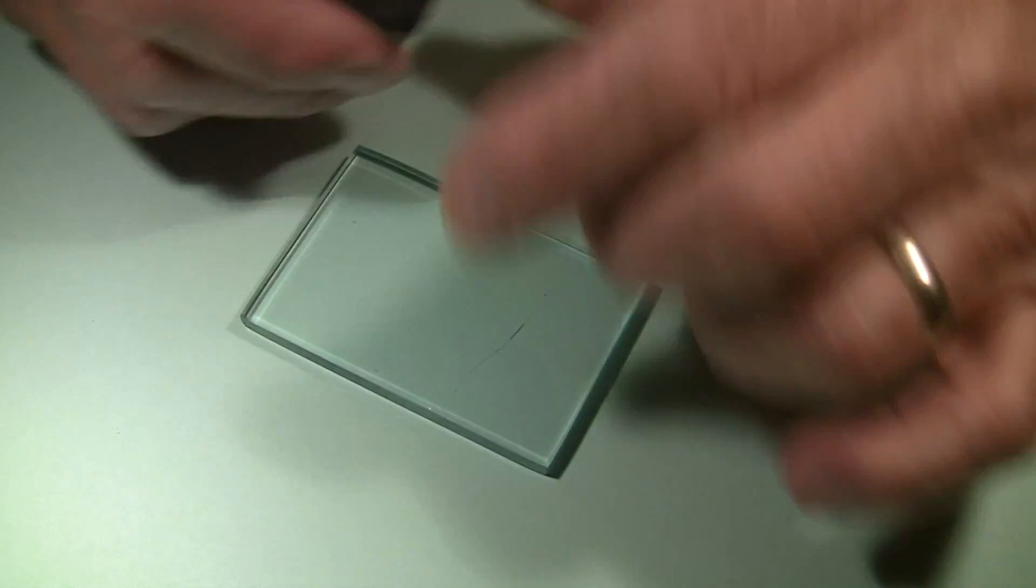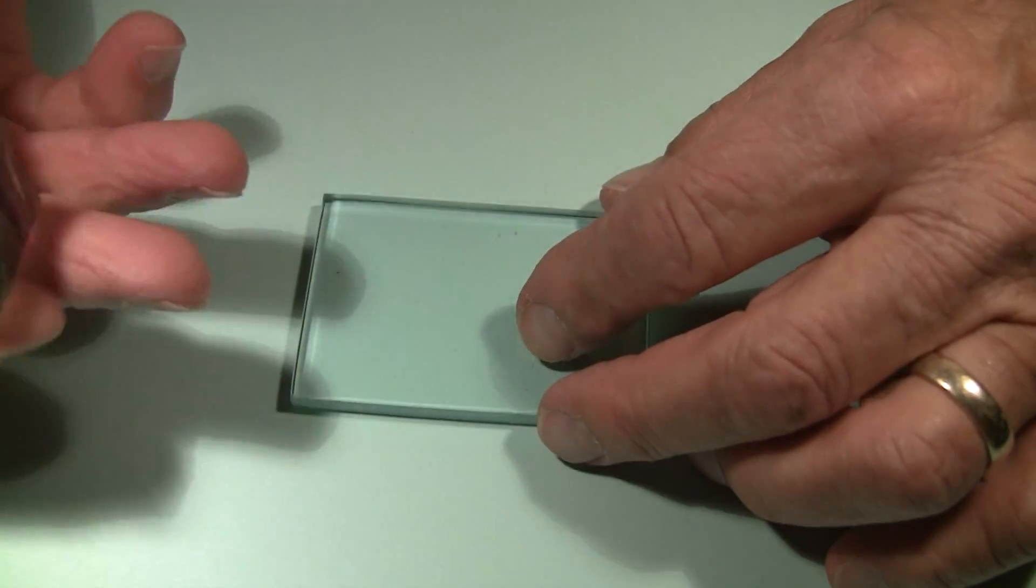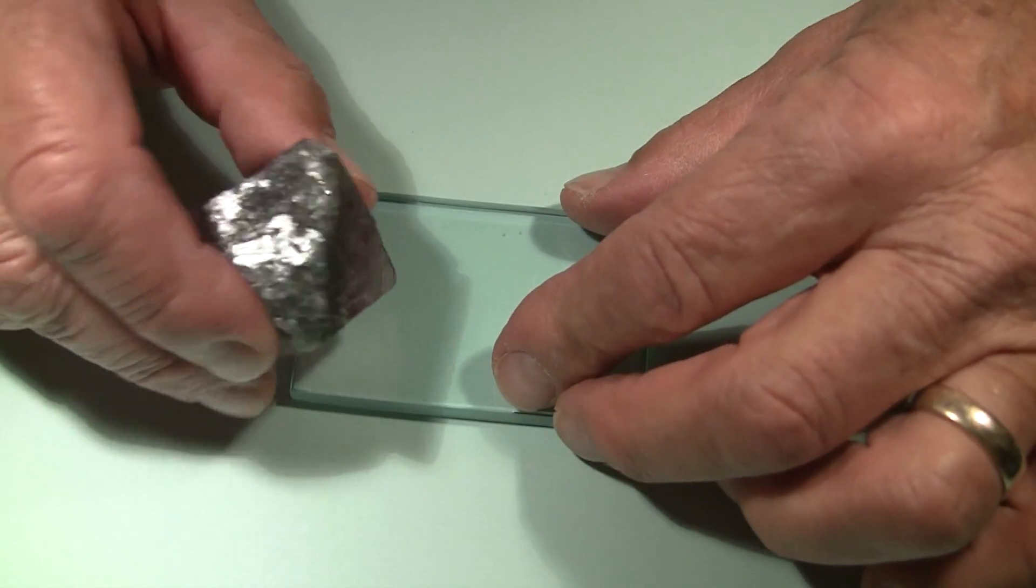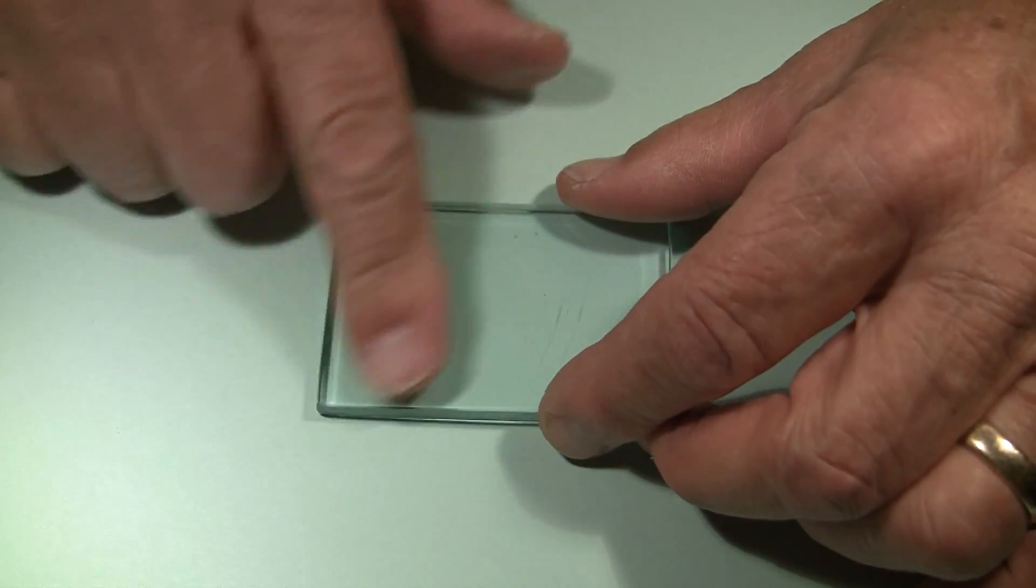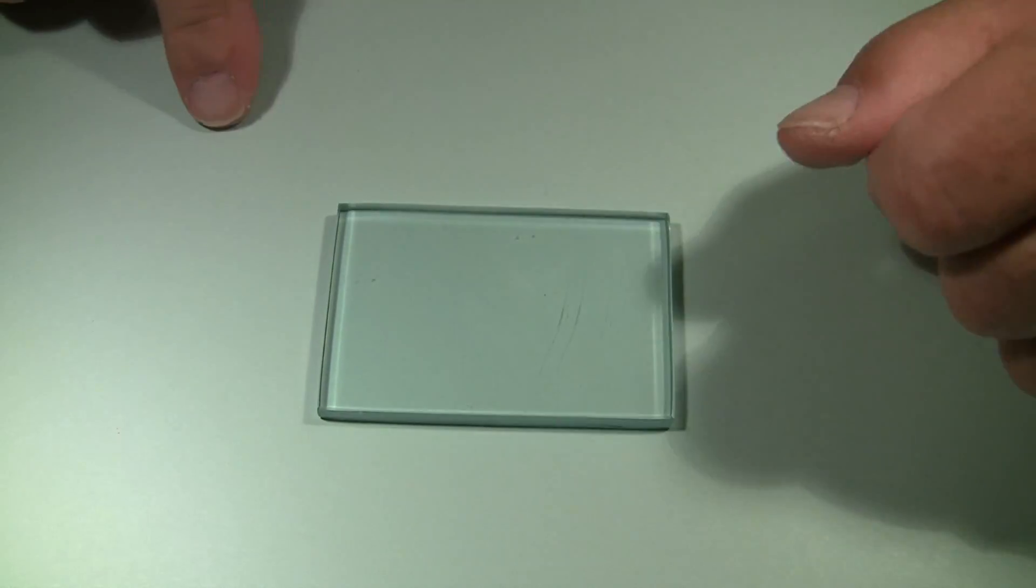Just to make sure, sometimes you want to reverse the process. Here's the glass plate. We'll take this point here, rub it across there, and I can feel it just sliding across the glass plate. So fluorite is definitely softer than 5.5.